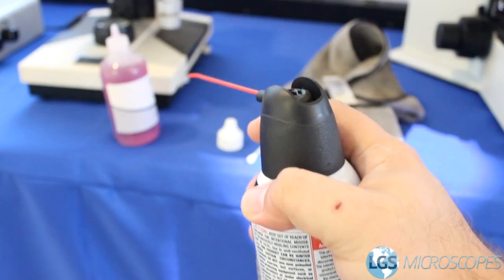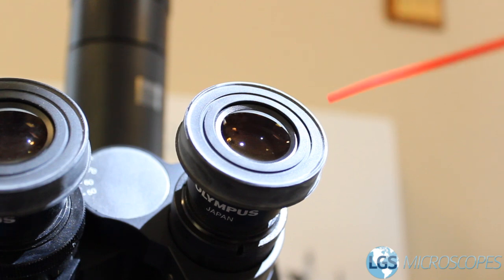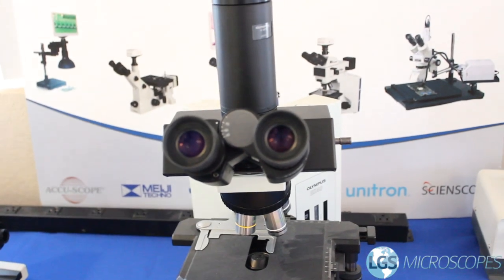After you're done wiping off the eyepiece, grab your can of air and spray it off gently to get rid of any lint particles that might have been left behind from the q-tip. If after cleaning the outer surface there are still some specs you can see inside the eyepiece, it's better to leave that alone because those lenses inside are put together in a very specific way. It's better to leave that to a professional to clean the insides of those lenses. Once you're done with the first eyepiece, go ahead and repeat the process for the second eyepiece.